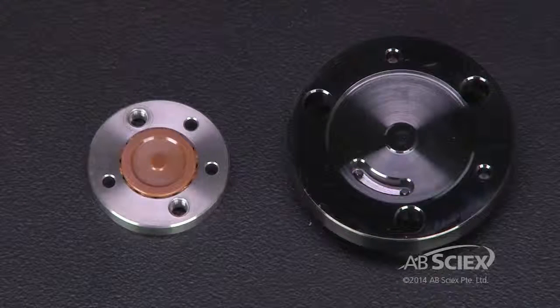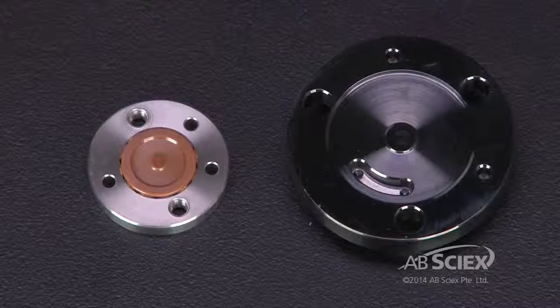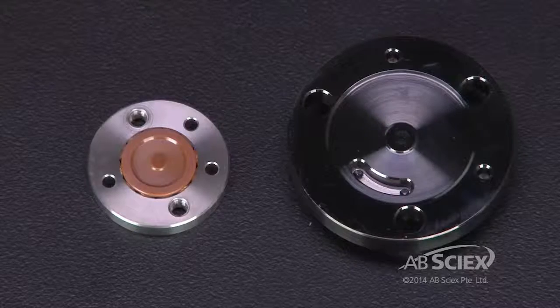The stator is the front portion of the valve containing the ports. The rotor seal is behind the stator and forms the liquid seal between the ports of the valve.